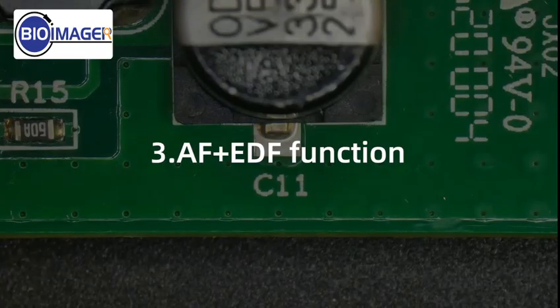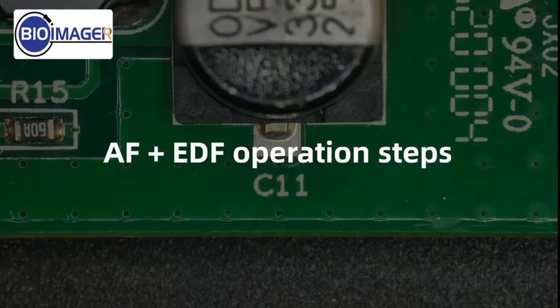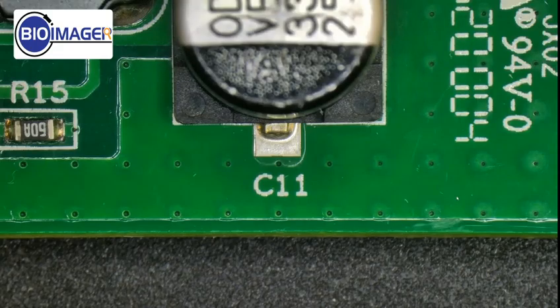AF plus EDF function. AF plus EDF is a new function that combines the camera's unique focus function with EDF. Users can focus on different areas in high magnification scenes, and then fuse their respective clear areas to finally obtain a large depth of field image. AF plus EDF operation steps.